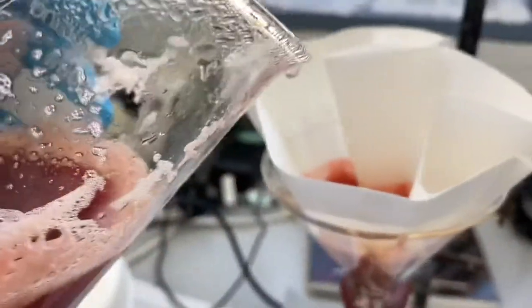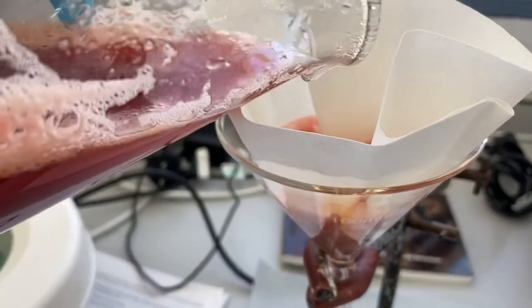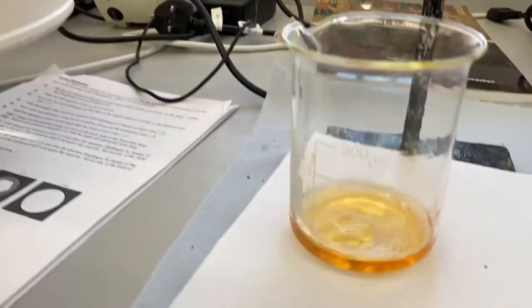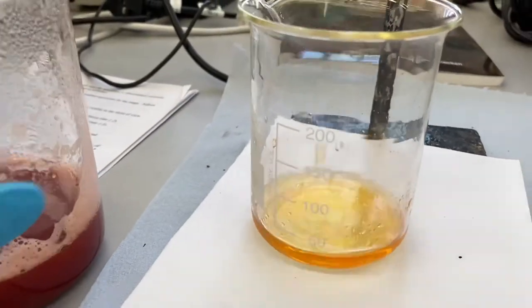The solution is taken and then it is once again filtered into a new beaker. This time it moves even slower. And once the first filtration is complete then it's filtered again with demineralized water until it's clear and no further color comes off.